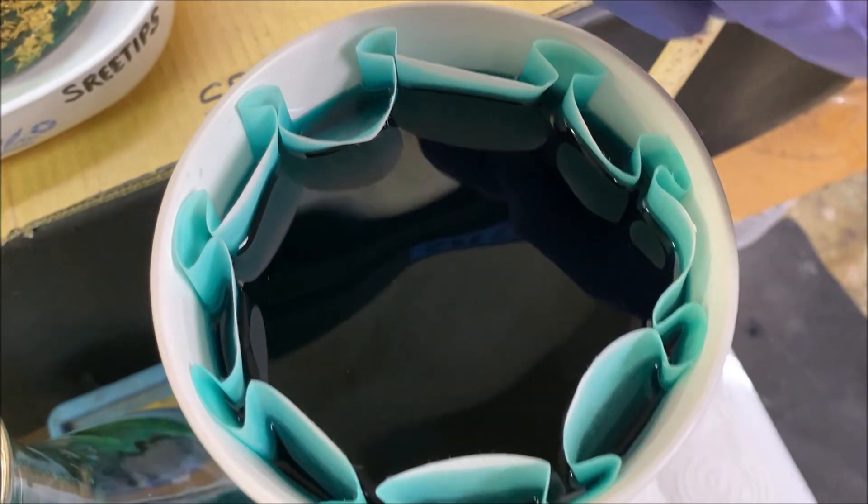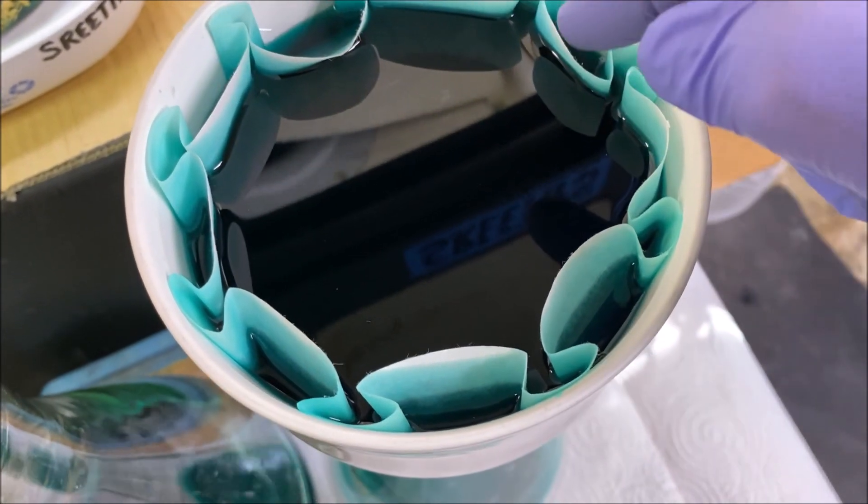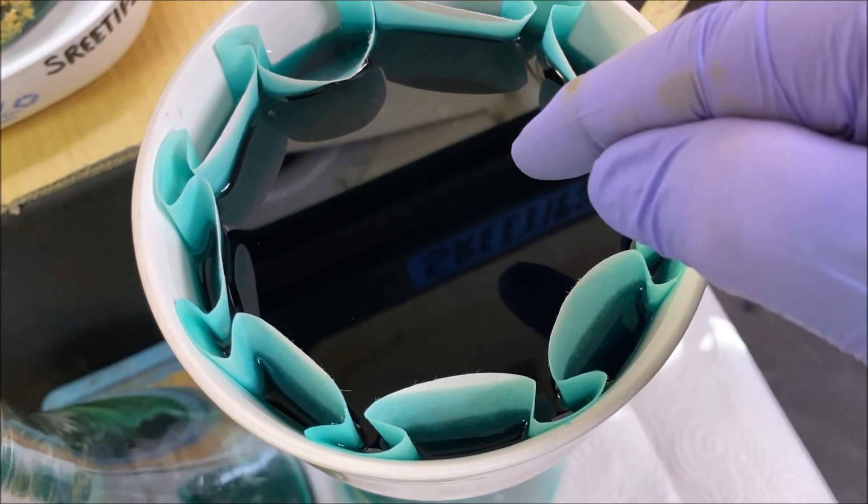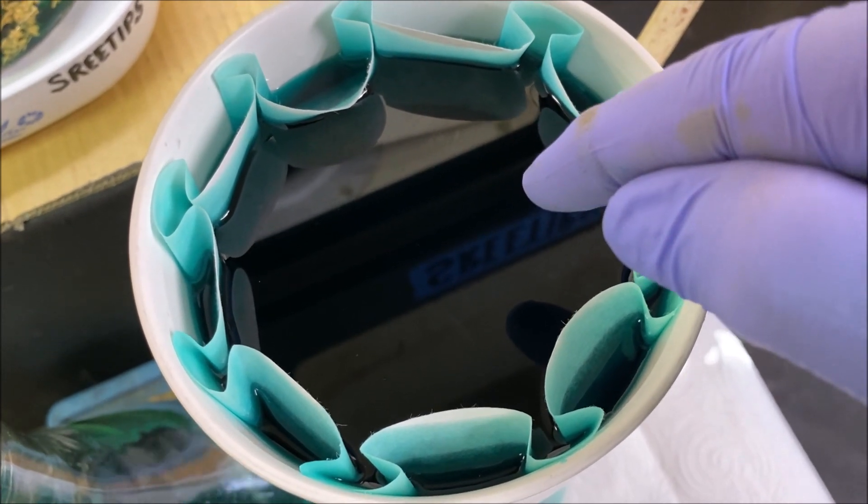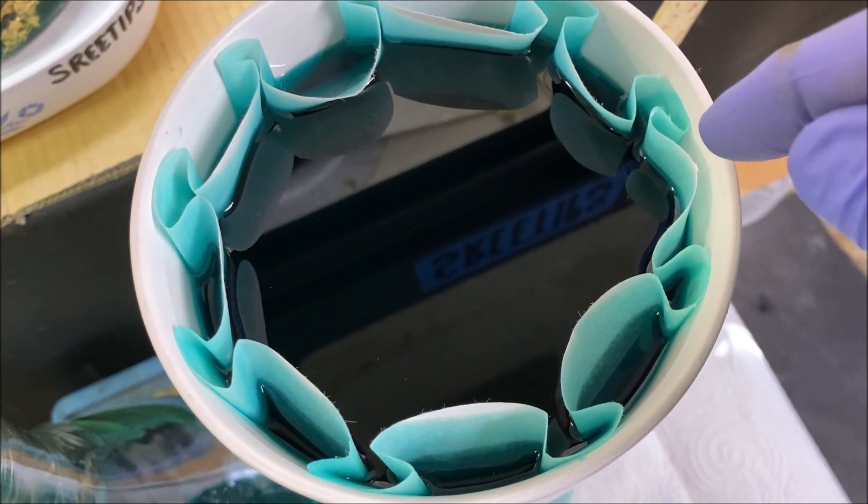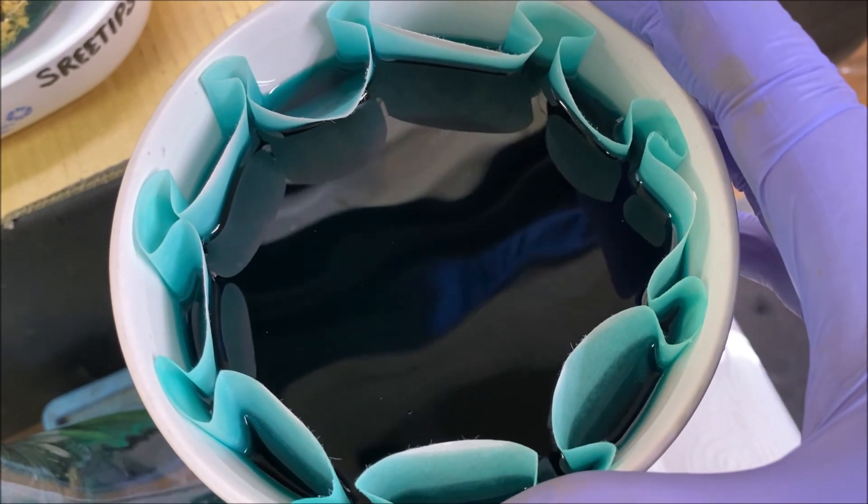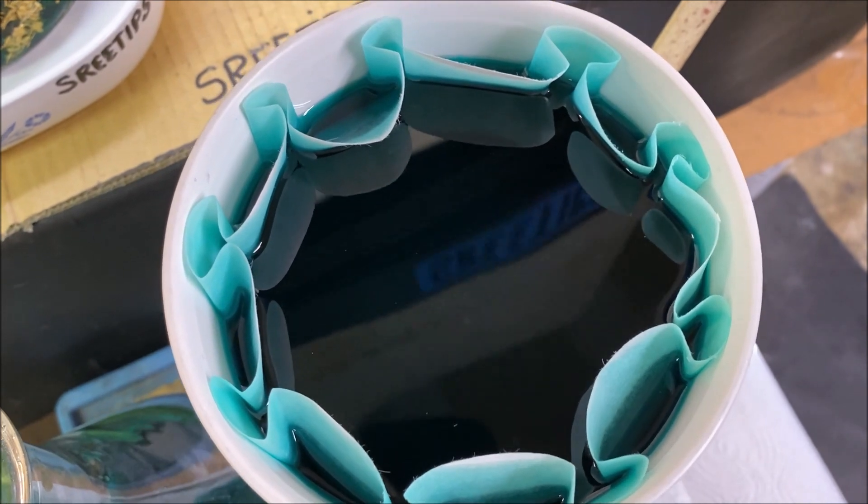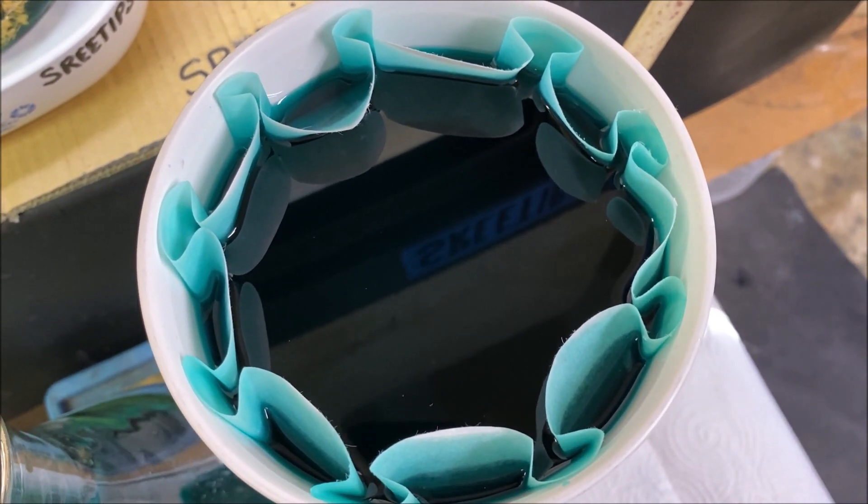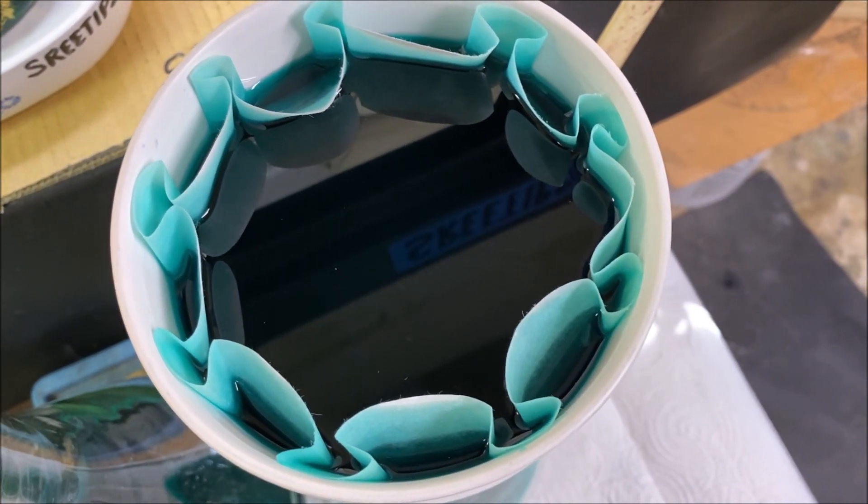And you'll see that the liquid that we're filtering, we're gathering the solids here. The liquid can get through the filter paper, but none of the solids can come in contact with this funnel. That's the advantage of using one of these specially prepared filter papers.